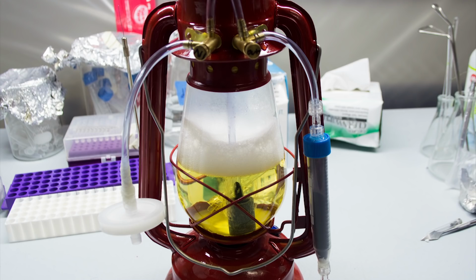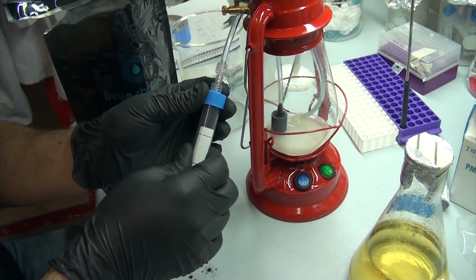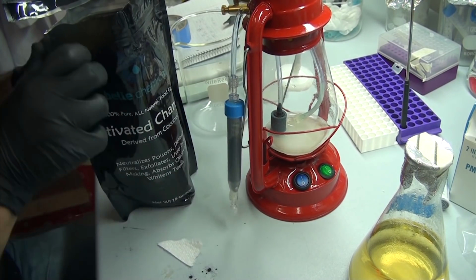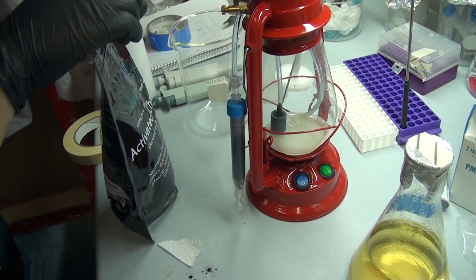The last things were to add an inline HEPA filter to the air intake, and a carbon filter to the exhaust so my lab doesn't reek of E. coli. The carbon filter I just made out of two luer lock connectors and a 15 mL Falcon tube, which I then filled with activated charcoal. This is nice because it's easy to refill, and a small piece of paper towel on the bottom is all that's required to prevent the charcoal from leaking out.